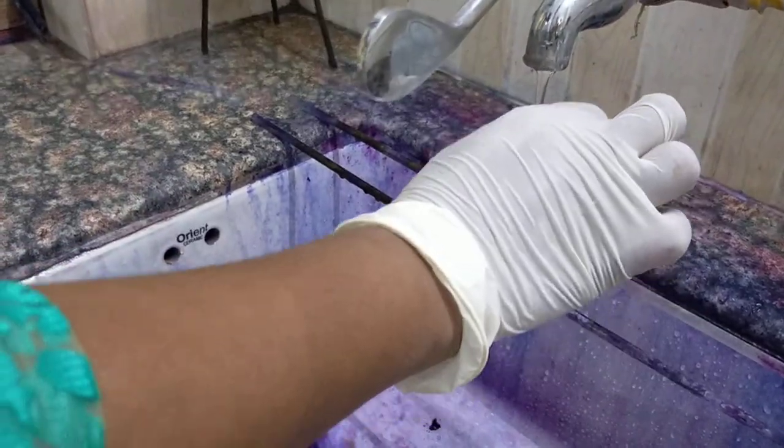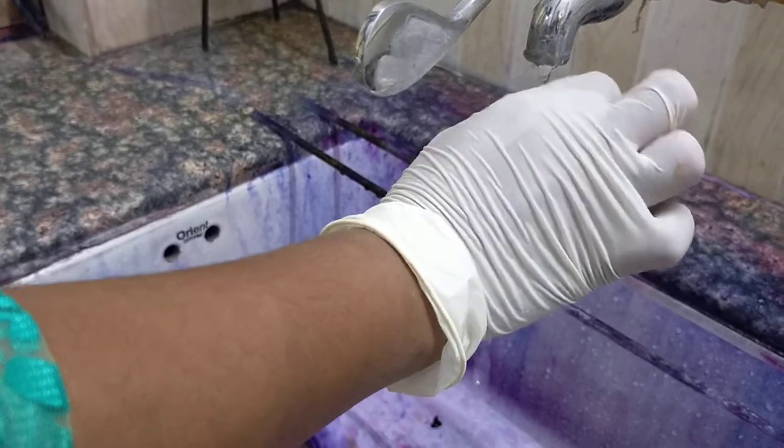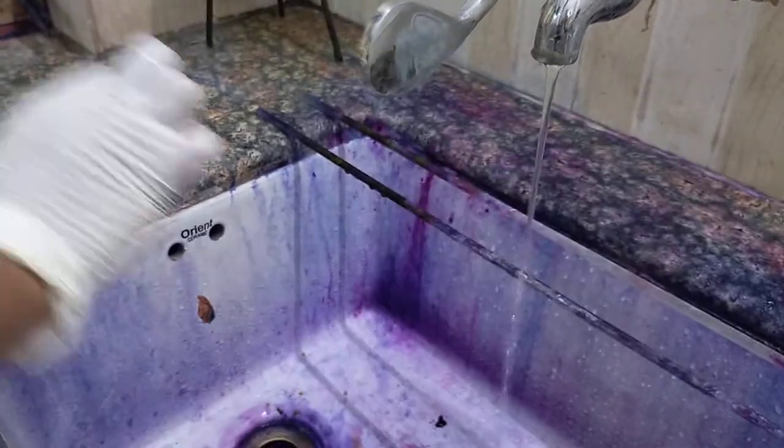So after washing, we will air dry the slide and then we will focus it under oil immersion to visualize the staining.